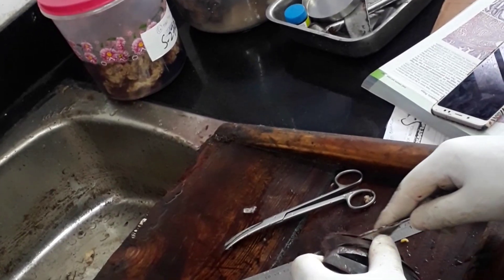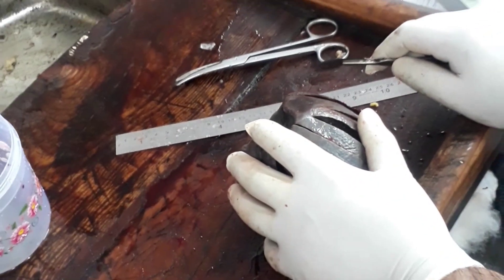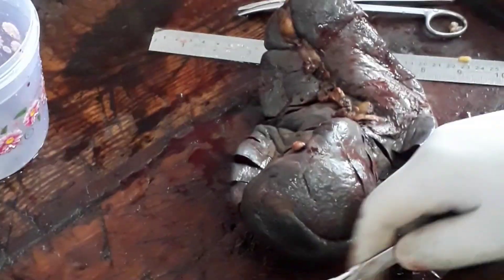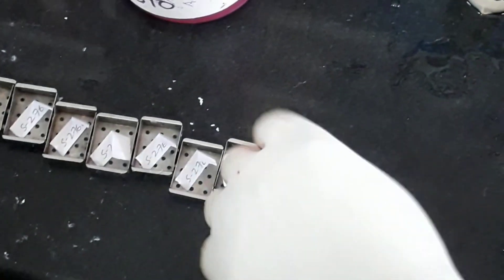You can see the darkness in the area. The pathologist is taking the first section from the hilum and will place this tissue in the tissue block. After that, the tissue processing will start.